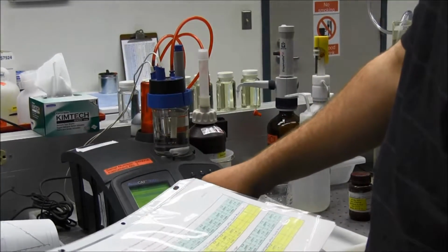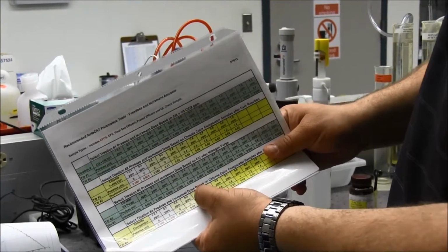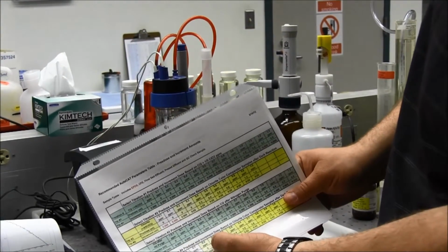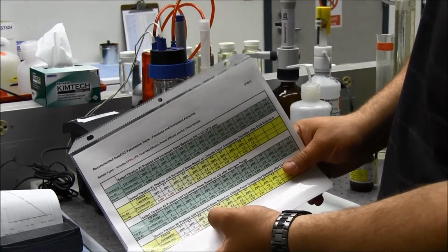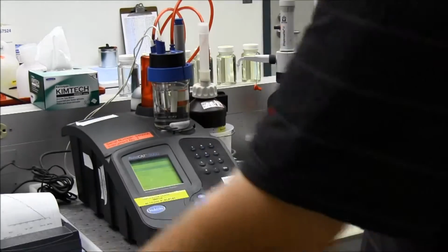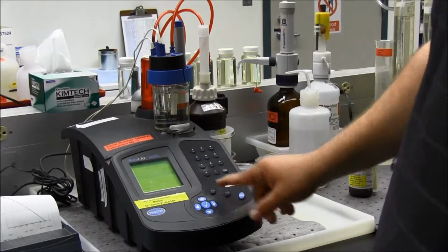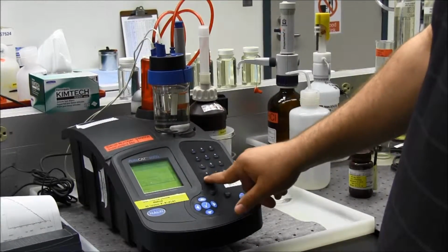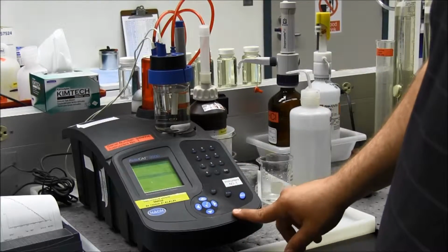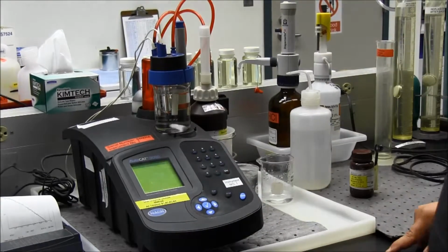Now I'm going to set my pre-dose and my increment again. So it's saying 0.4. I'm going to drop it down again just a little bit lower, which would be 0.3. So I'm going to go 0 as a pre-dose and 0.02 as an increment. So I'm going to go 0. I'm going to come down to my increment, change that to 0.02. Check mark to confirm. And 1 to start the test.